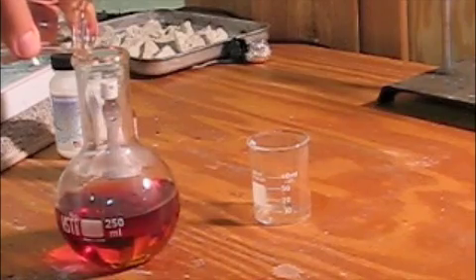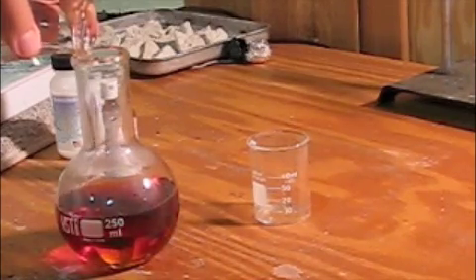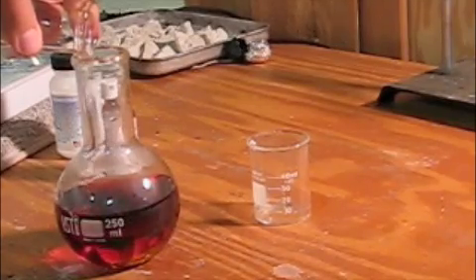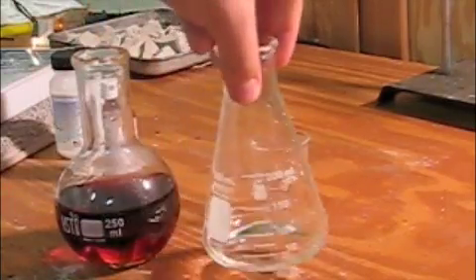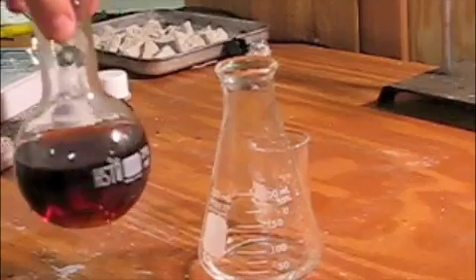You saw it start to go yellow. Now you can see that distinct brownish-purple color of an iodine solution.